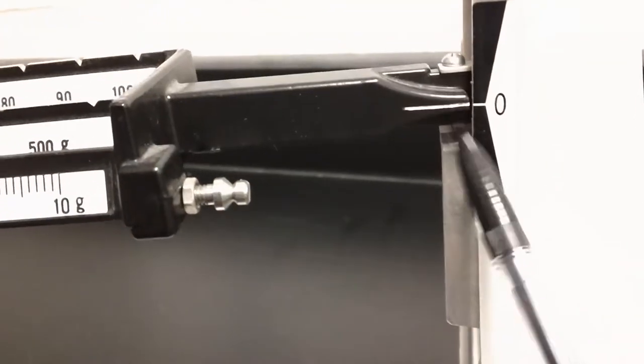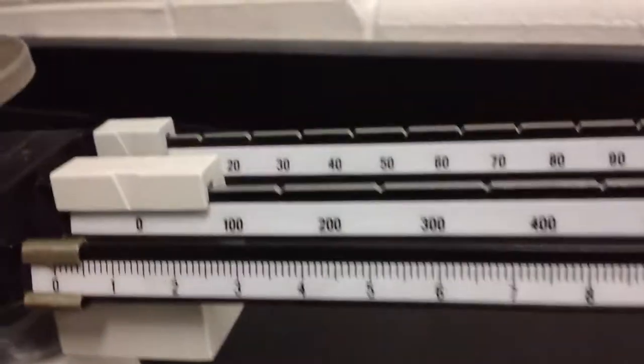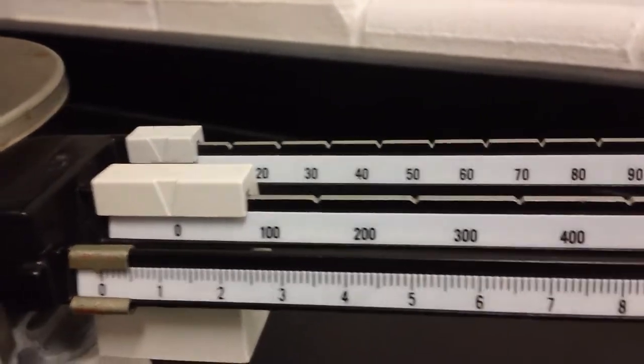If this were either up or down, I would have to check my counter masses to make sure that they were all zeroed out, or I might have to do a little calibration on it.